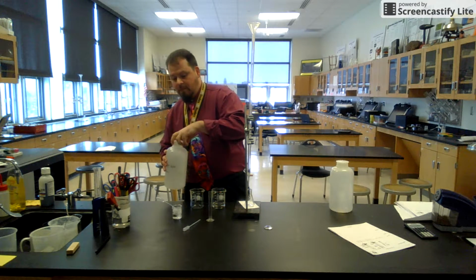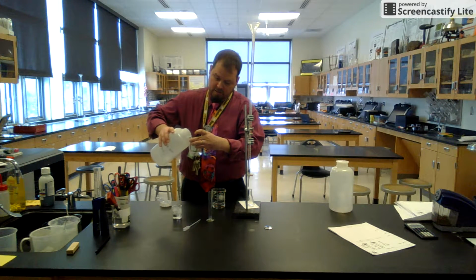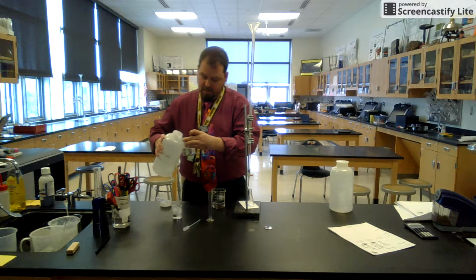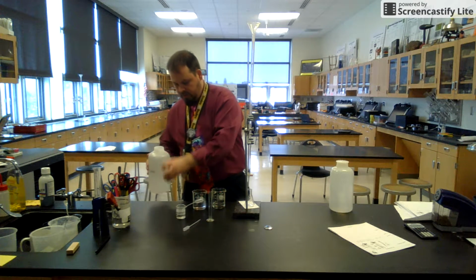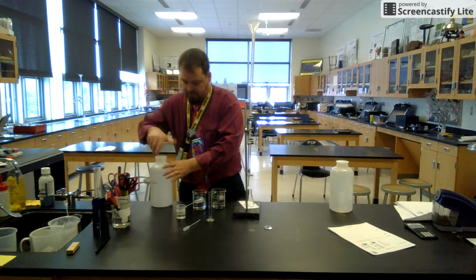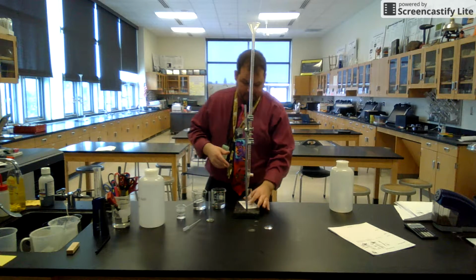There is only one beaker of the phenolphthalein indicator from the indicator lab that we did last week, and that's here. This will be over by the windows. We're going to have to share and play nice. Okay? Got it? Play nice. But we're actually not going to play because this is science lab.